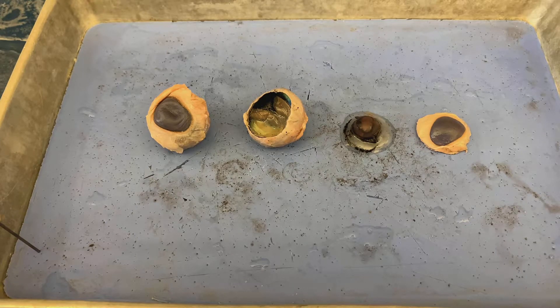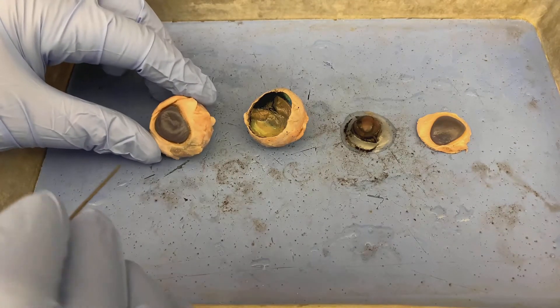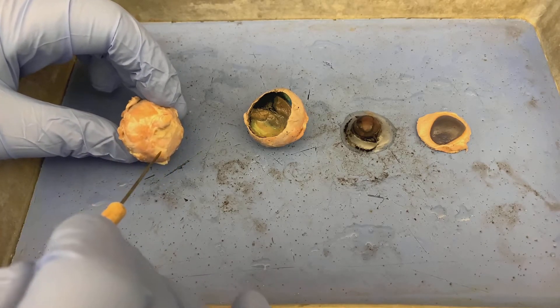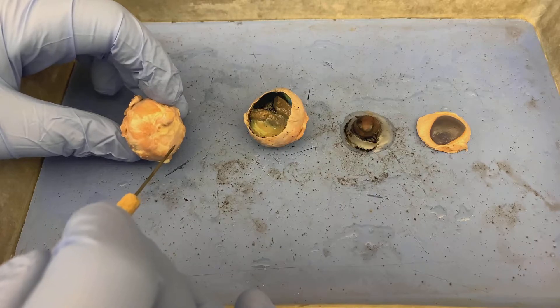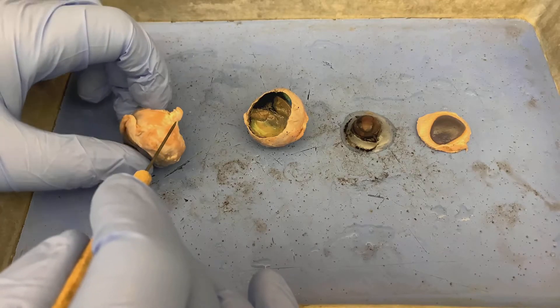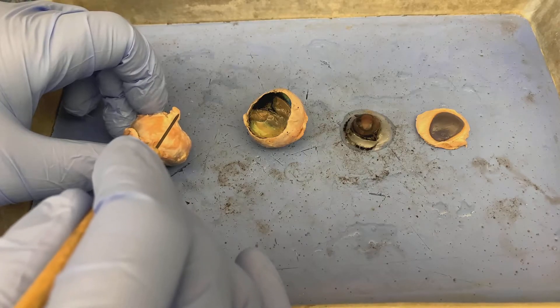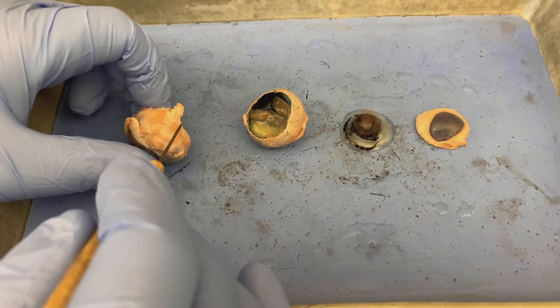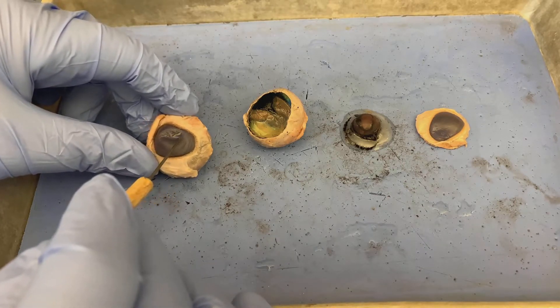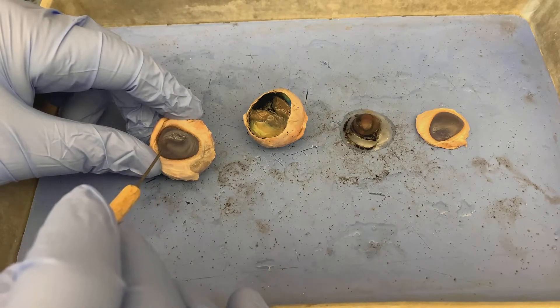We're going to work our way through the actual sheep eye. We're going to start with the entire sheep eye here. What I've done is I have trimmed some of the musculature and fat away from the posterior side of the eye to expose the optic nerve, which you can see actually sticks up and off of that posterior portion of the eye.